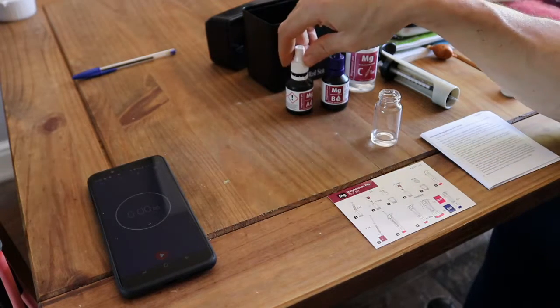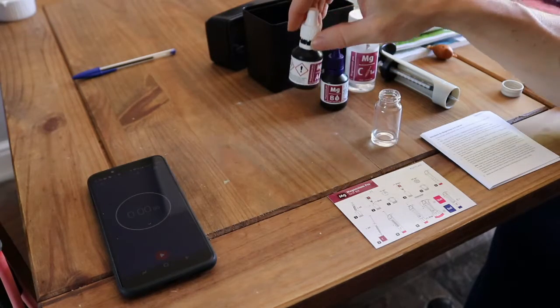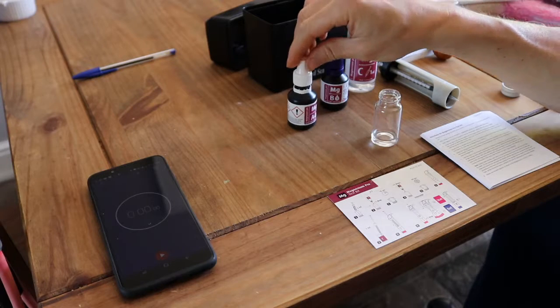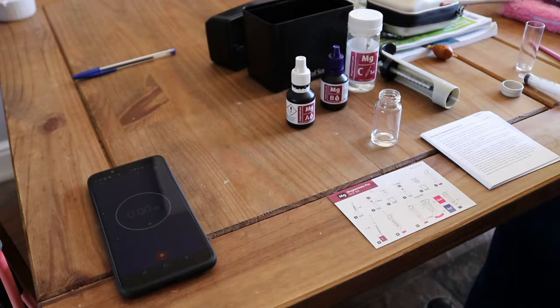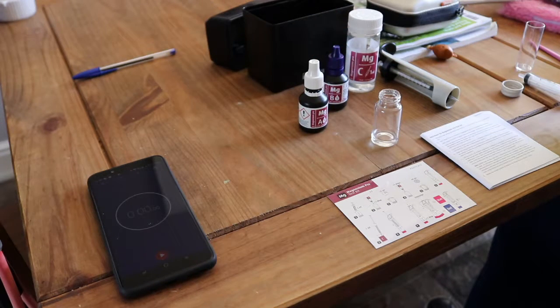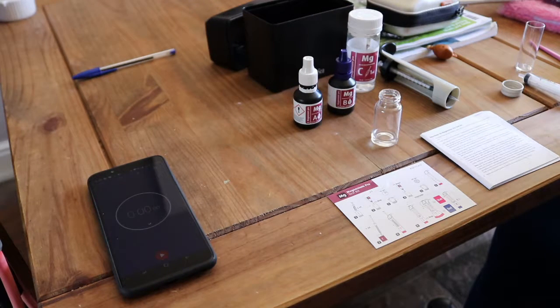The other thing is a lot of people say, do you really need to shake between each drop of A, because you do your 5 drops and shake? They do seem to stress the emphasis on doing this test to the letter. So people have done tests where they don't bother shaking at all in between each drop. They just drop, and then shake it for a bit, then go on to B. But they do seem to say to mix between each drop. So you might as well, although it's a bit more aggro, follow the instructions to the letter, and then you're going to at least have more faith that you're getting it right.